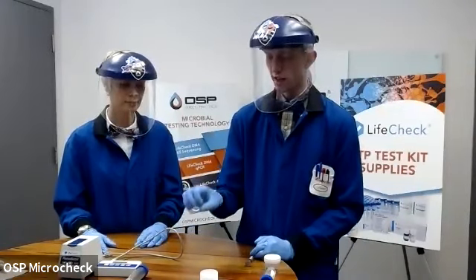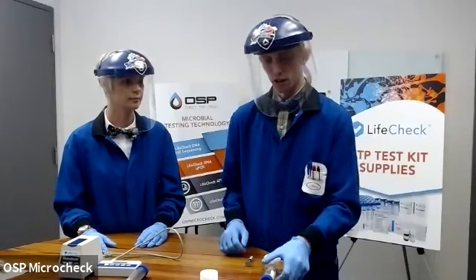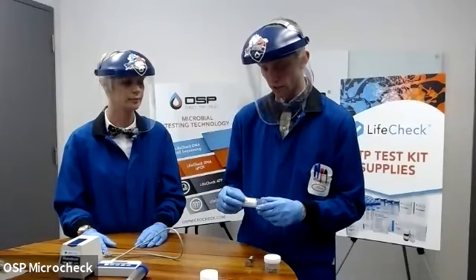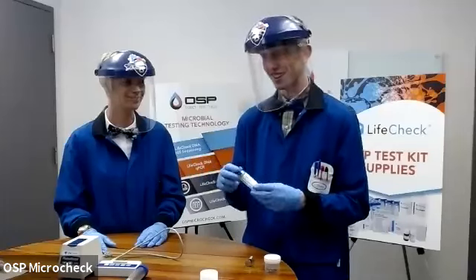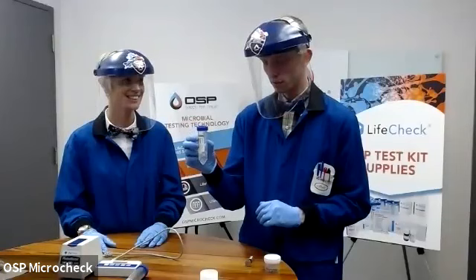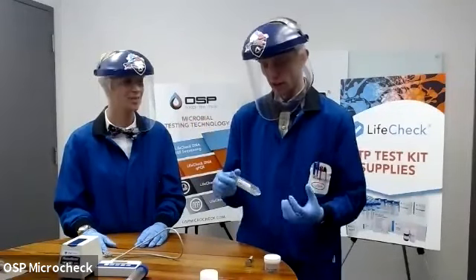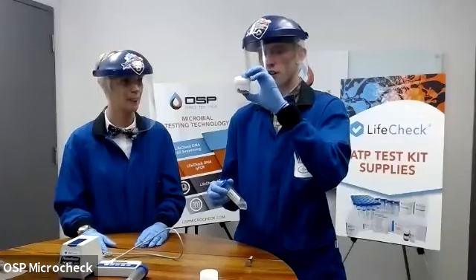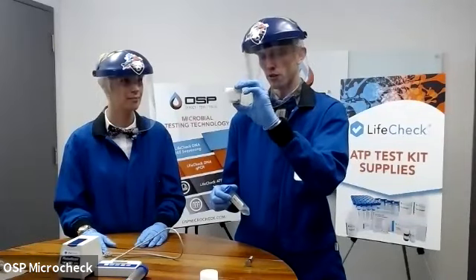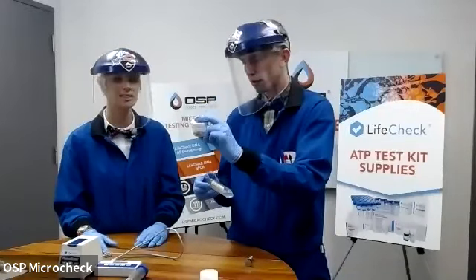And I did mention that that actually is an adaptation from our sessile or solid testing kit. So now seems like a good time to actually tell you about our solid testing offering, which of course is the larger Reagent X tube with the 10 mils. And the intention of this is so that you can test a variety of different solids, whether they are pipeline scrapings or pig returns, debris, that kind of thing.